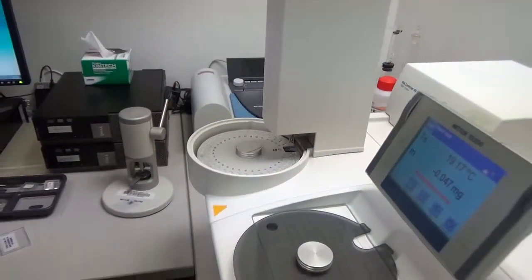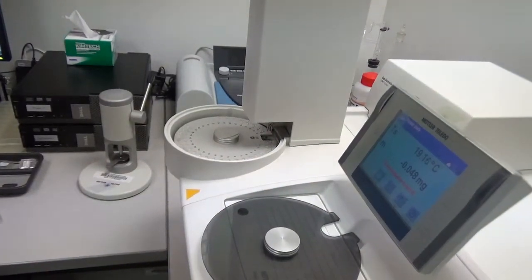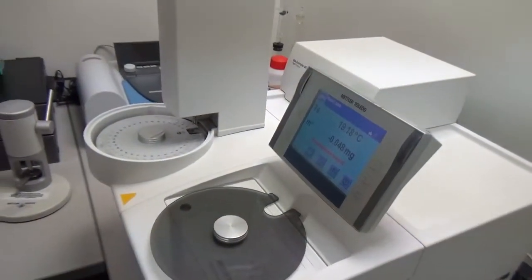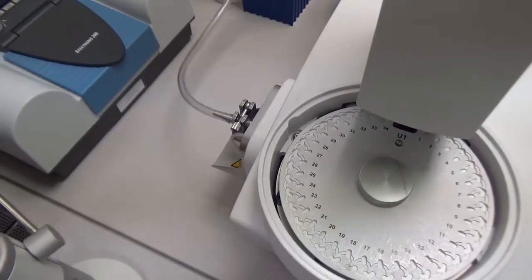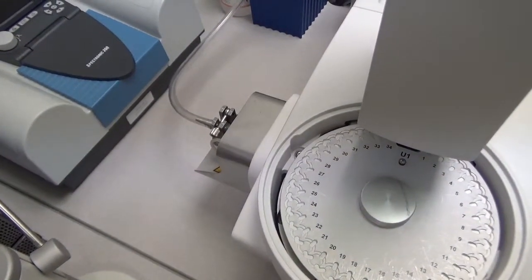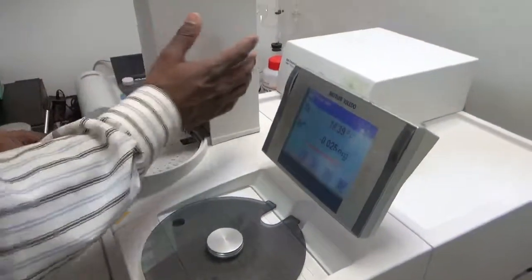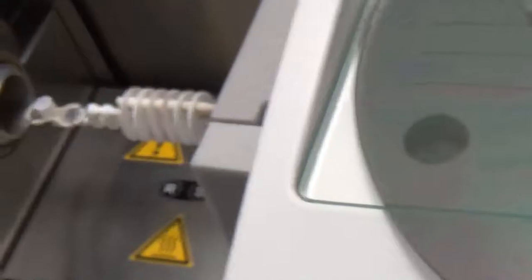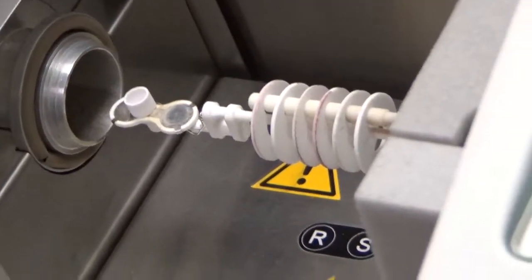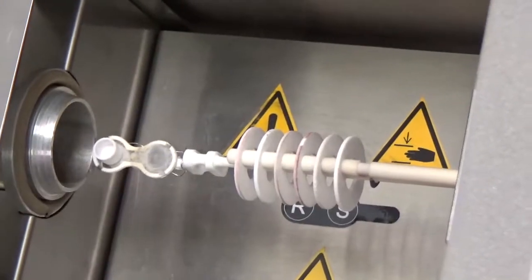Once the sample loads, the furnace opens and the sample goes inside. To show you how it looks — you press the furnace button and it opens. Once the furnace opens, I can move this tower. You can see the sensor I was talking about — the TGA SDTA sensor with a platinum support. You can see there is a reference crucible, an empty alumina crucible, sitting in the middle. That always stays there.